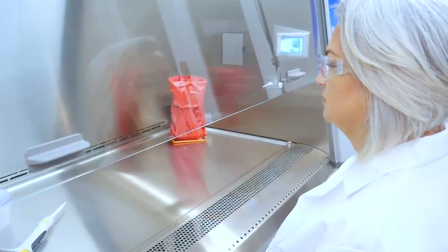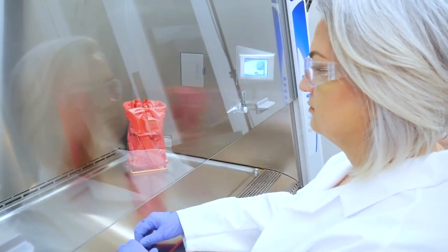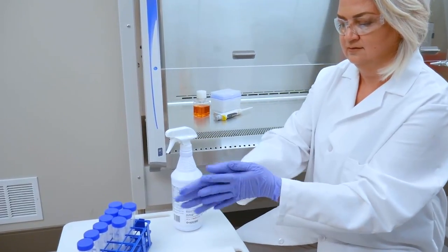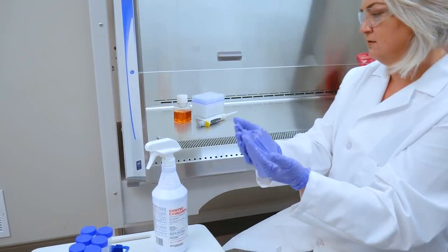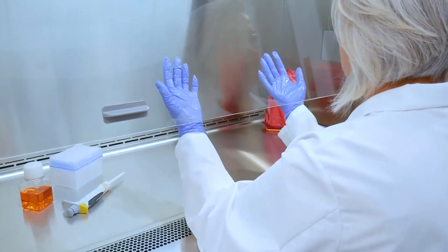Good ergonomics promotes safe work. Adjust your chair to a comfortable height, making sure your nose and mouth are above the sash opening. Next, thoroughly disinfect your hands. Enter the cabinet slowly to minimize turbulence and wait one minute before starting any work to allow the cabinet to purge its interior.